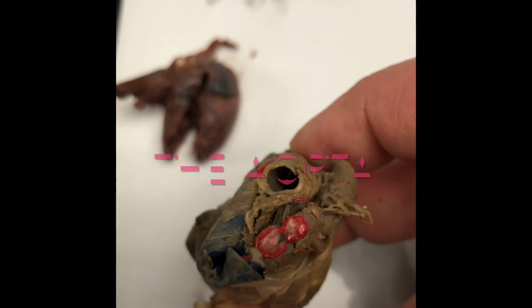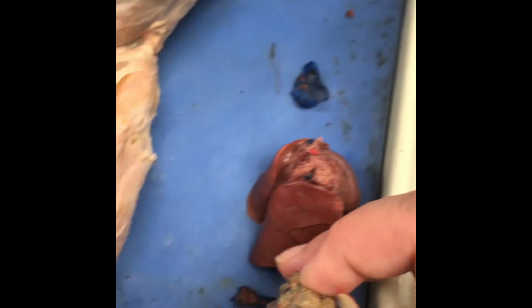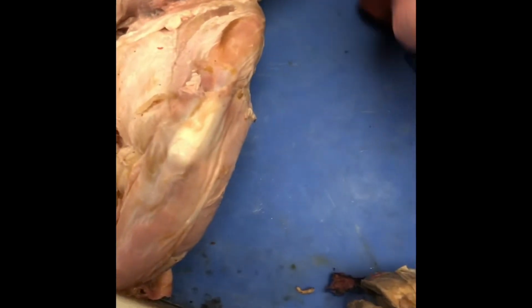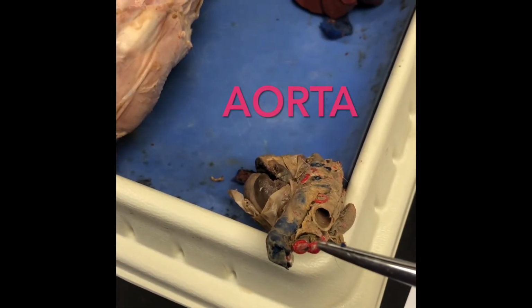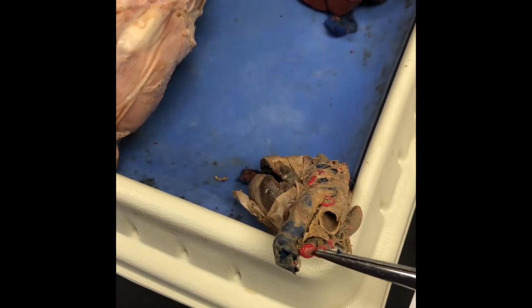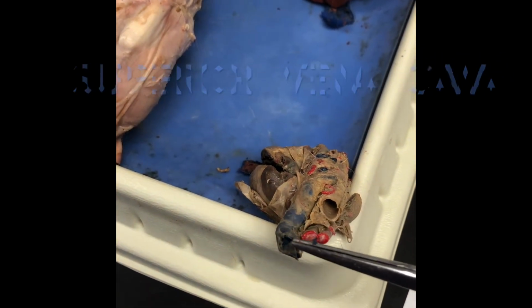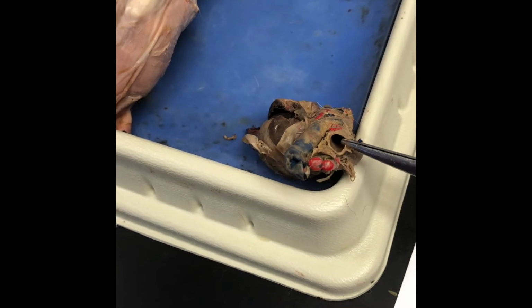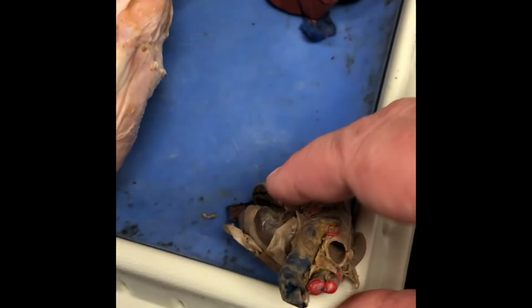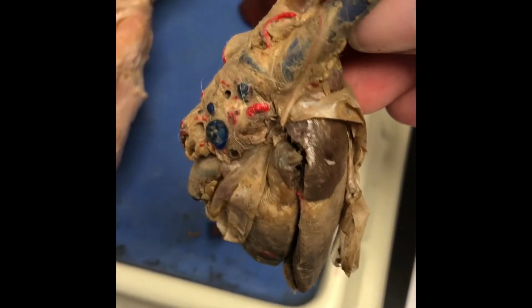So again, you see the aorta dyed red, the superior vena cava dyed blue, and that hole that you see is the trachea. So aorta, superior vena cava, and then the trachea. So you can see where they are all in relationship to each other. And that is at the top of the heart, looking down on that cat heart. So we have a couple different hearts set out here. That is the cat heart, and you can see the pericardium on it as well.